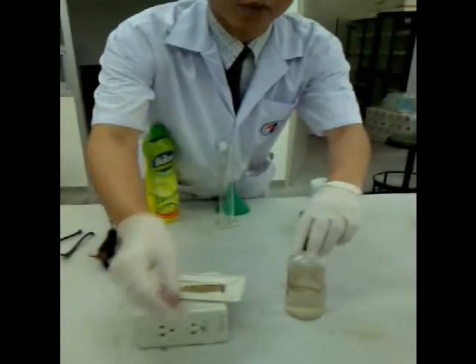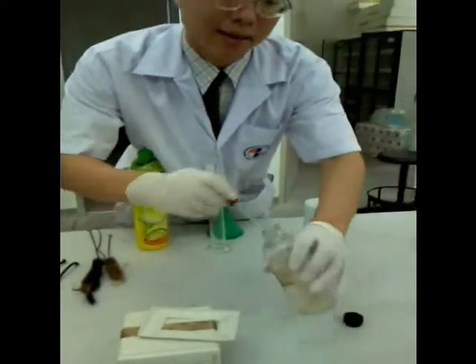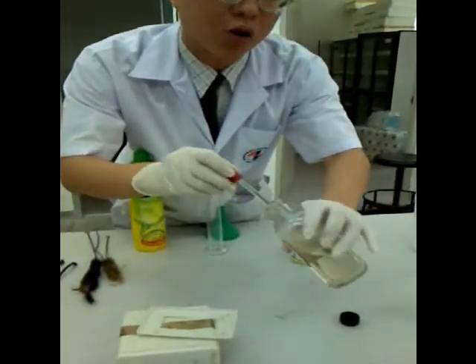We're going to put it on this purple crystal to make manganese heptoxide, a green, ugly liquid. And the gas that will come out will be O3, or ozone.